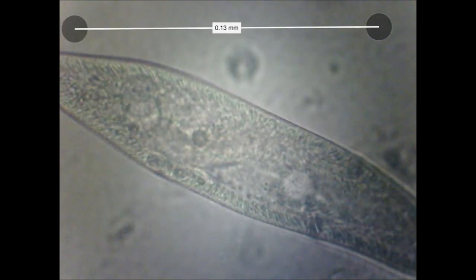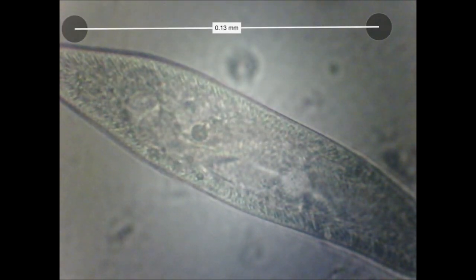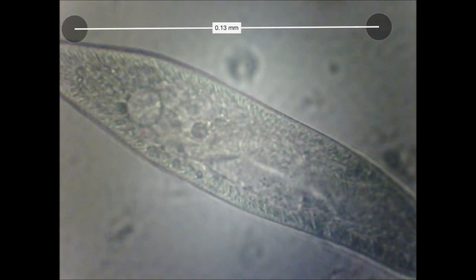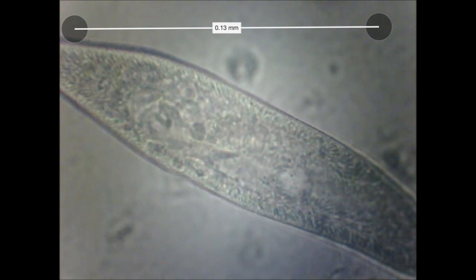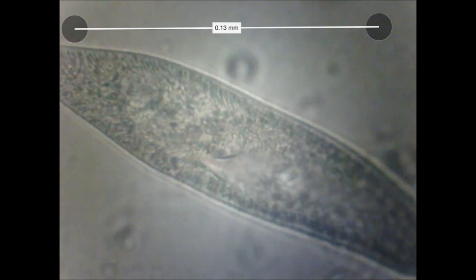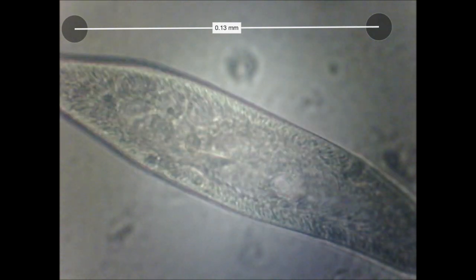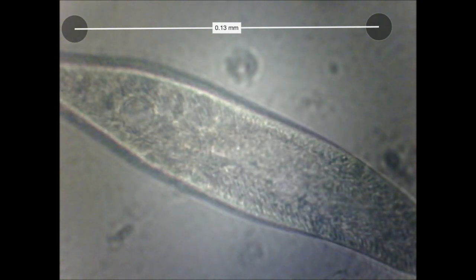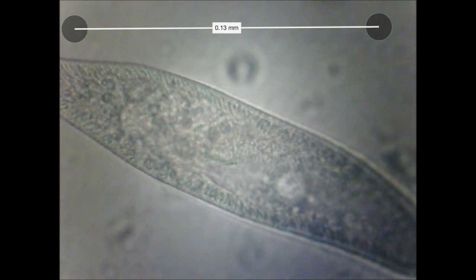Another issue you deal with as a paramecium is water balance — in this case you're going to drown if you can't pump water out. You'll notice in the middle and then to the left there are vacuoles that occasionally squeeze, and they're pumping excess water out to keep the cell from drowning, because osmosis is always bringing new water into the cell.